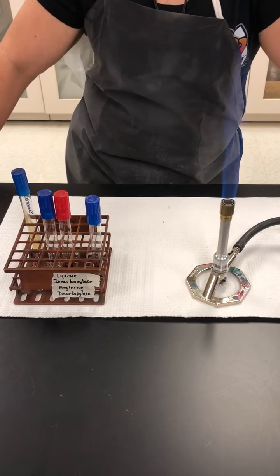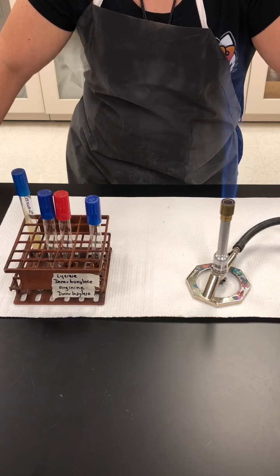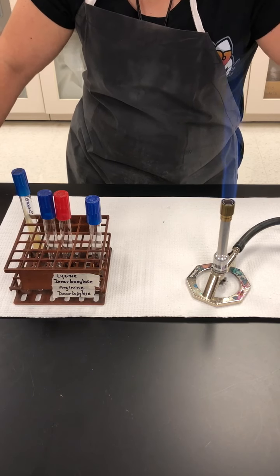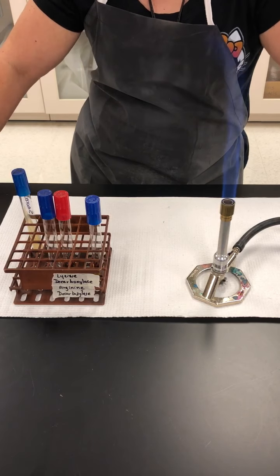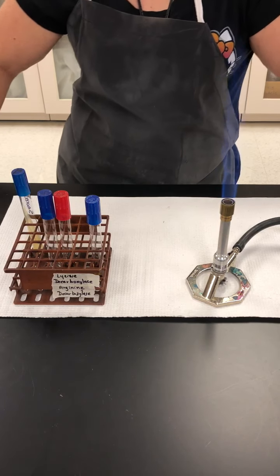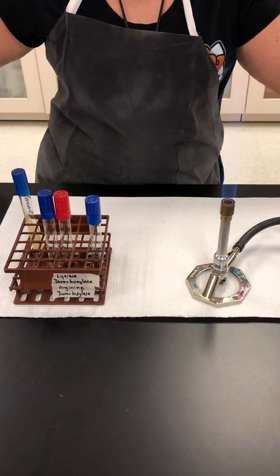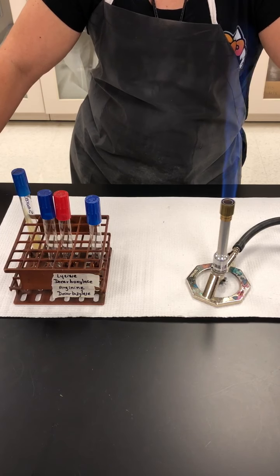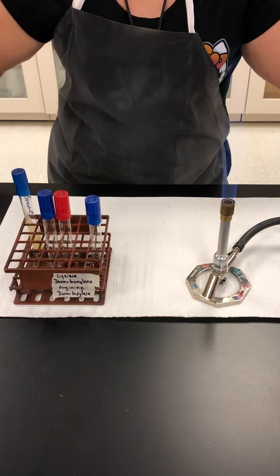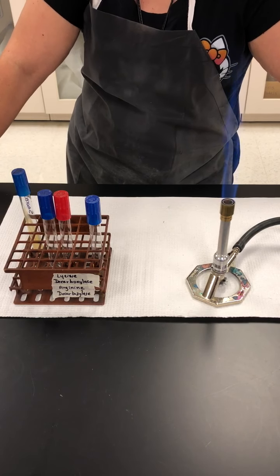I'm going to demonstrate how to prepare and read the decarboxylation test. The first thing I have to say is that there are many different types of decarboxylases. As you can probably tell from that word, decarboxylase is an enzyme that does the process of decarboxylation, which is going to be the decarboxylation of an amino acid. There are several amino acids, so that means that as many amino acids, there will be decarboxylases.